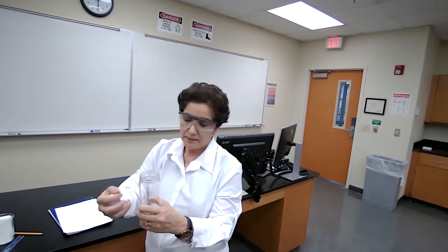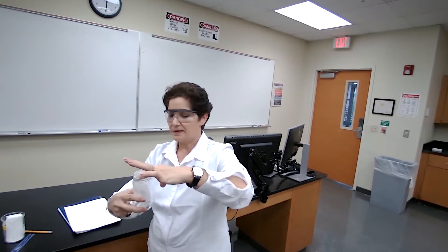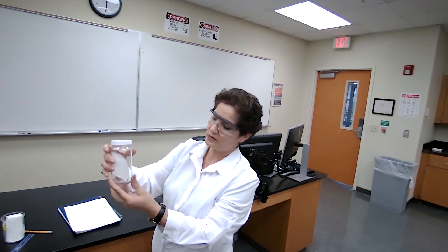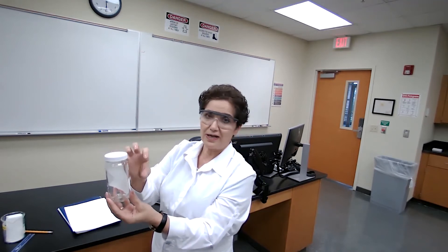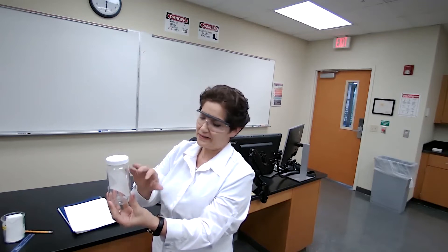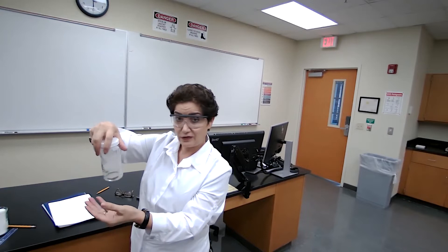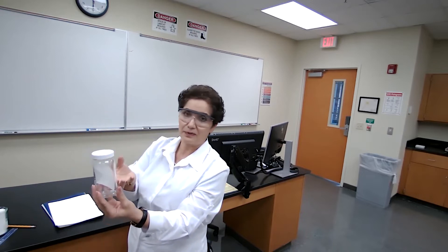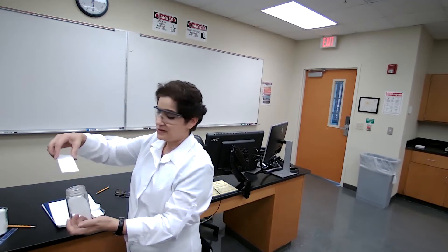I'm going to use a piece of filter paper, and that filter paper should be on the side of the glass. The purpose of this filter paper is that it's going to pull up the solvent when we add the mobile phase to the jar, making the air inside the jar saturated with the developing solvent so that the solvent moving up the plate is more smooth. You can also close the jar and shake it a few times to speed up that saturation, because the solvent will evaporate.